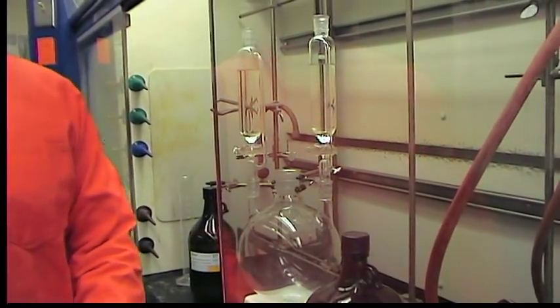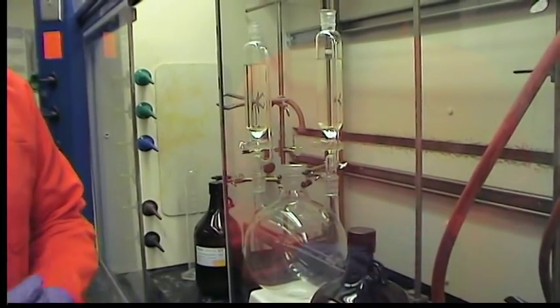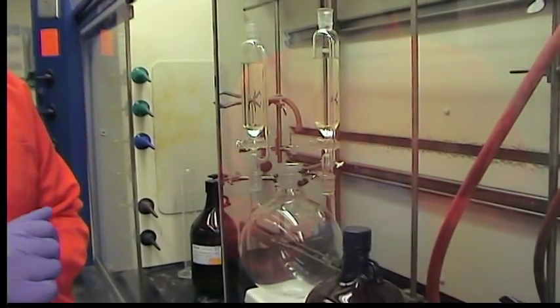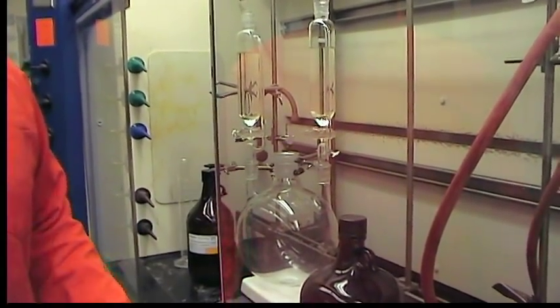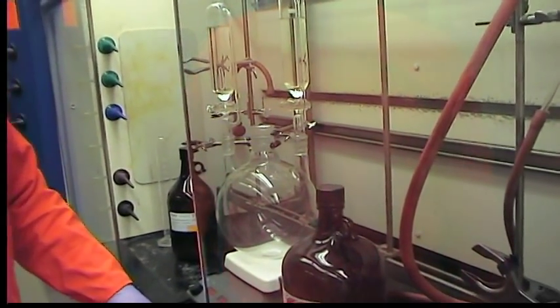We will be running the synthesis of the pyrylium tetrafluoroborate salt. For this we have prepared the setup here with a 5 liter round-bottom reaction vessel.